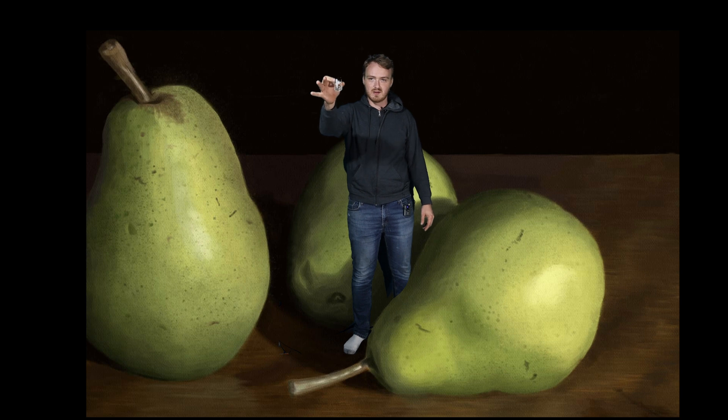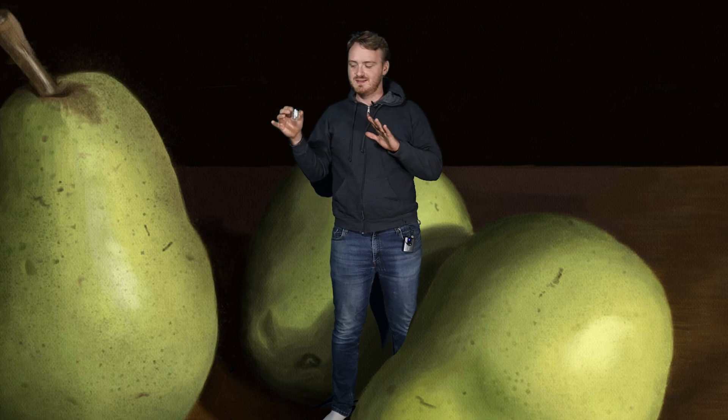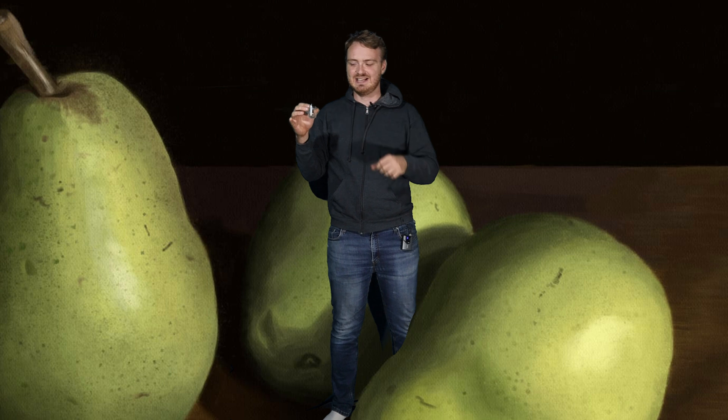Alright, so we have the propyl ethanoate here, and I'm going to go ahead and give it a smell. I don't know if I'd say that's a pear smell. It's sort of a sharpie highlighter smell. If you keep a distance, it smells like pears. But if you get your nose right up into it, yeah, I don't know.